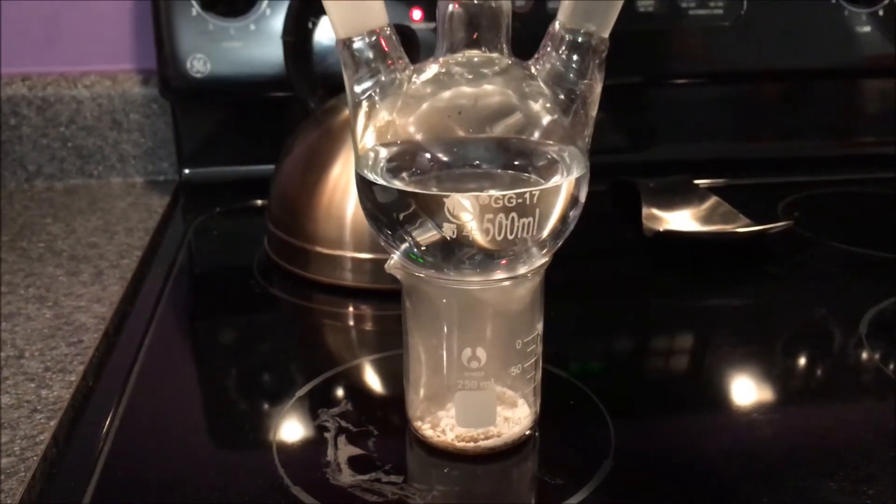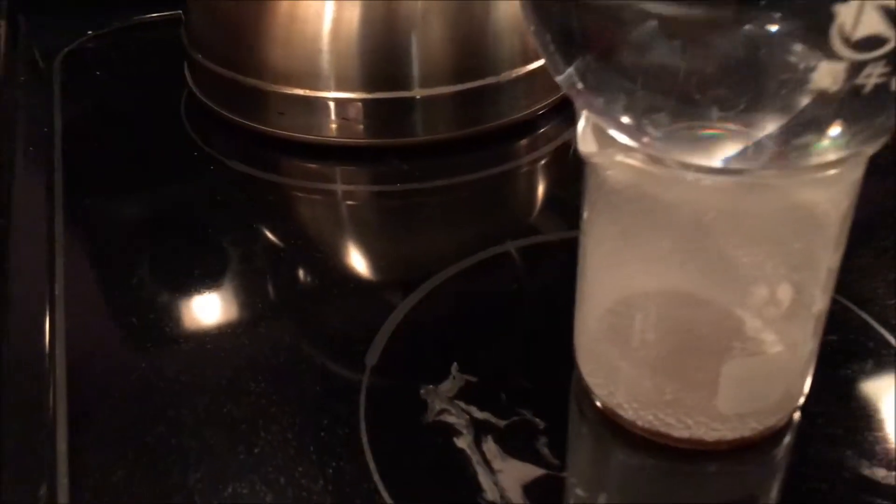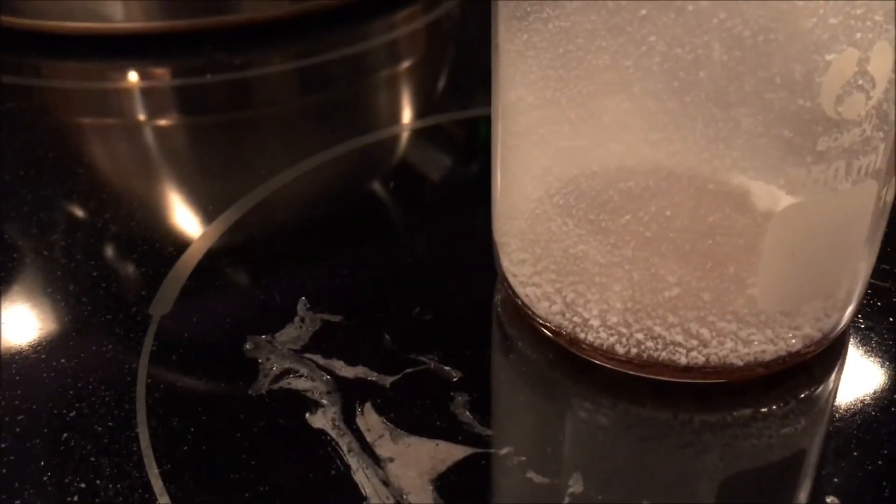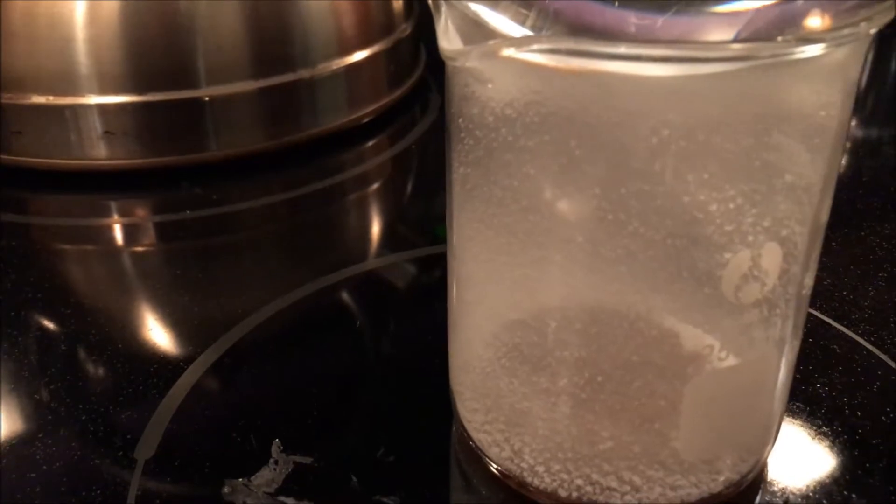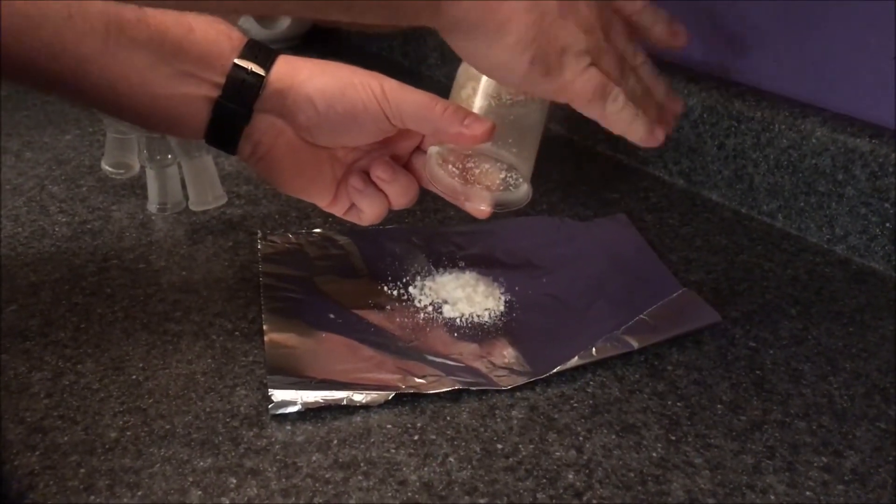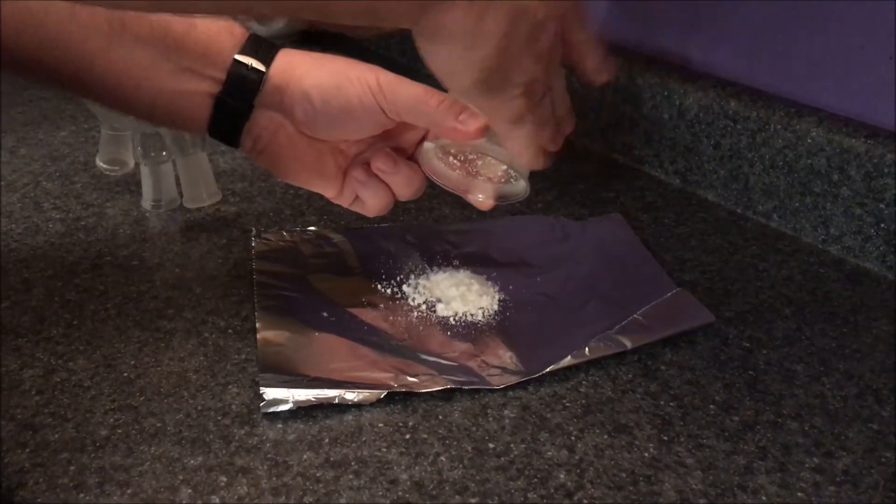The caffeine should vaporize and then re-solidify on the walls of the beaker. Tap the beaker until the crystallized caffeine falls out.